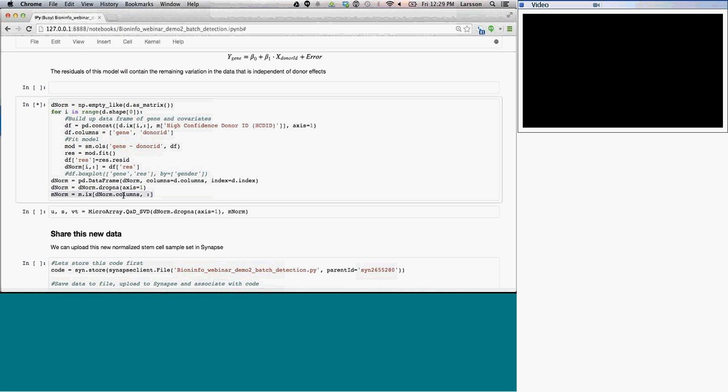And if I execute that, it's now going to go through every single gene and do these models. It actually takes a while to do because it has to do a single model 12,700 times. And as it's running, I'll mention that this will not give you exactly the same result as when we did the normalization by setting one singular vector to 0. And the reason for that is that we're now specifically only looking at donor ID. I said that already, but I'll highlight that. And we're not looking at the singular vector, which could be an effect that captures donor ID and other effects as well. And this is run. We're going to perform a singular value decomposition to see what this looks like. And this is still running, so it'll be a while.